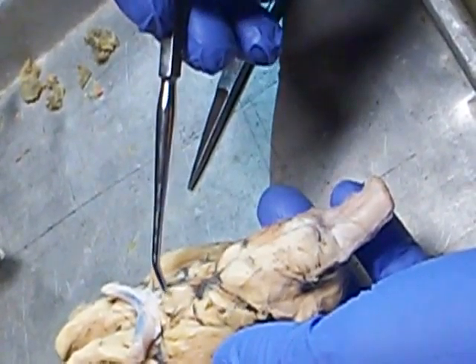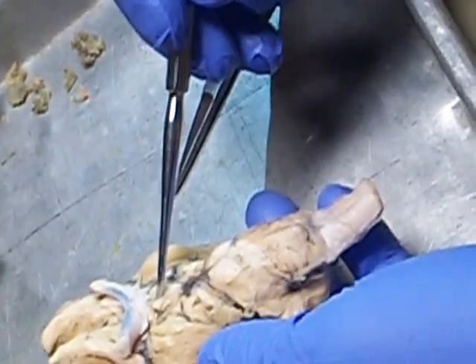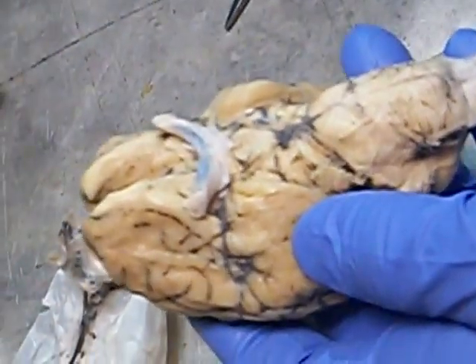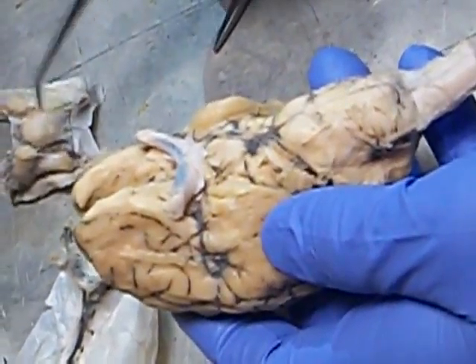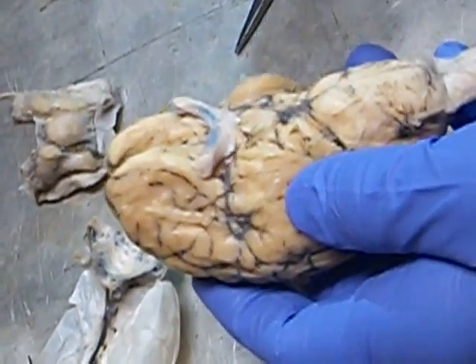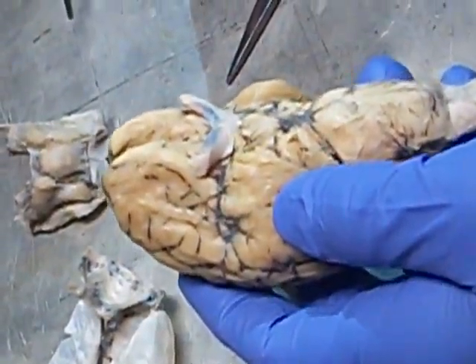This portion of the brain is called the mammillary body. But you can see this tiny little opening right here. Here's that connection from the hypothalamic region to the actual pituitary gland. And the little connection is called the infundibulum. I'll see if I don't rip it off on that one over there.